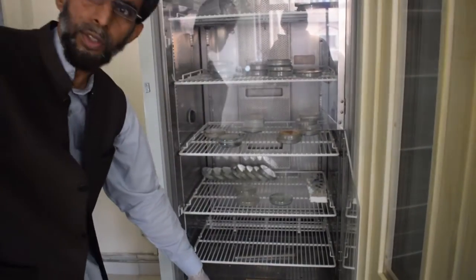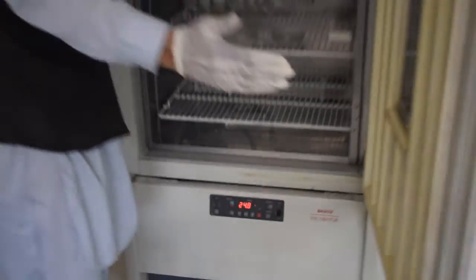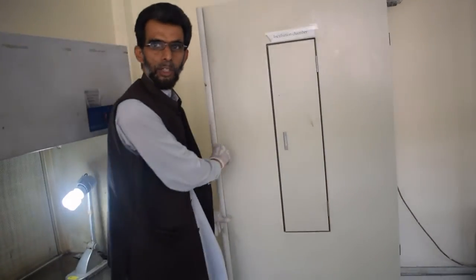All is there. You can observe what we did, and it is the whole procedure about the isolation of the fungi. Thank you.